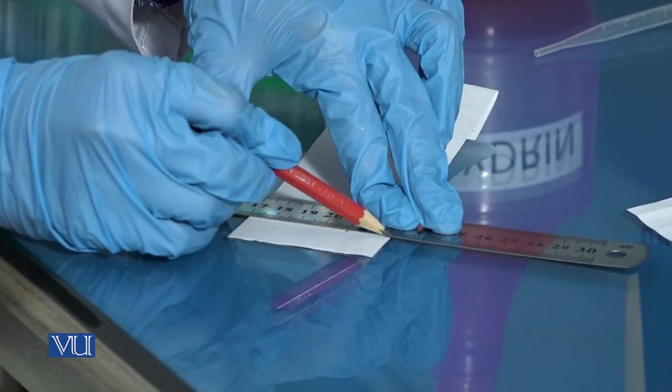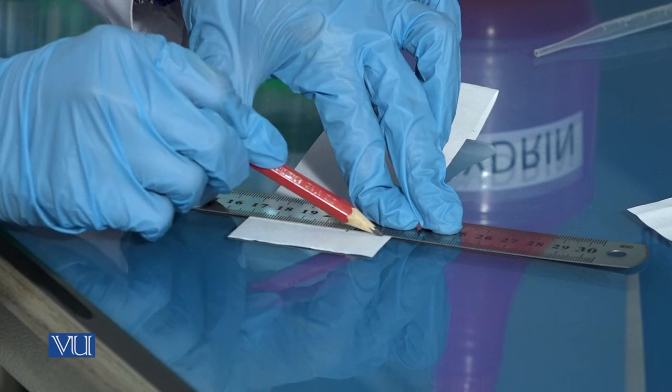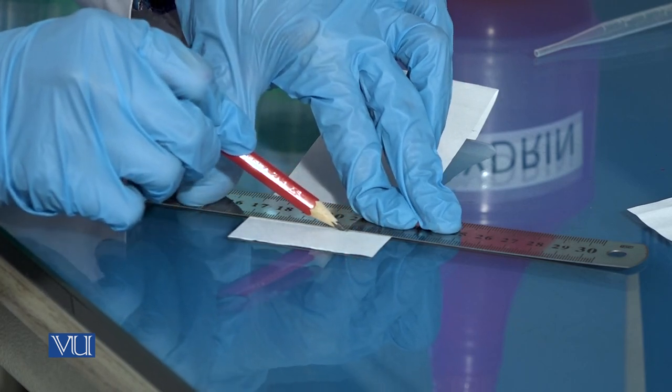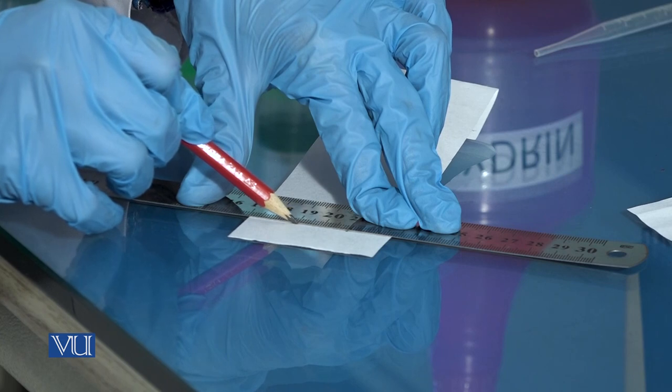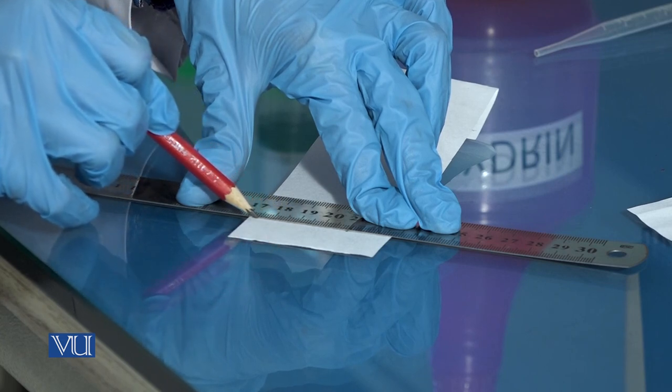Do not use any ink pen or ballpoint to draw this line, since they also contain compounds that will interfere with the results of the chromatography.